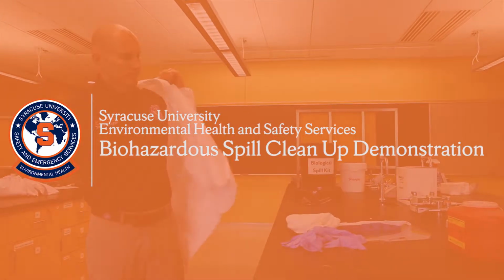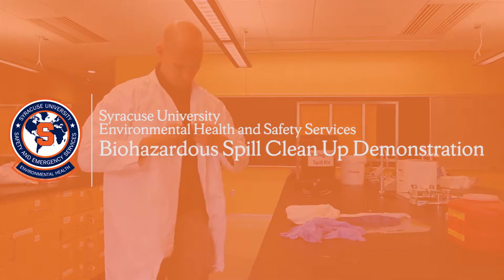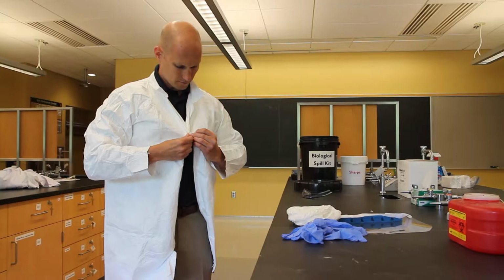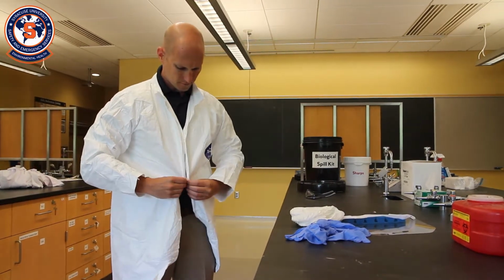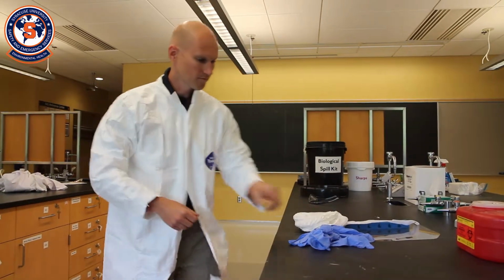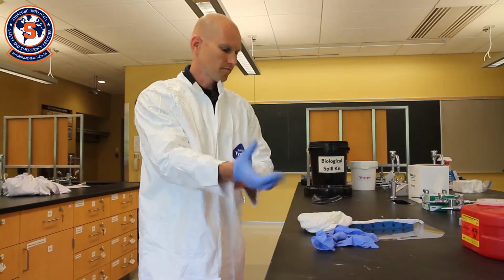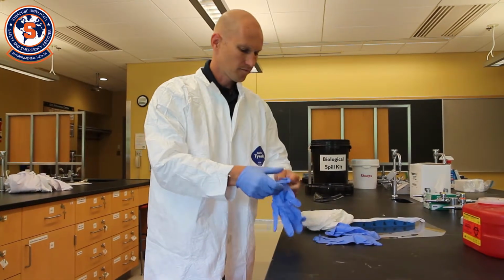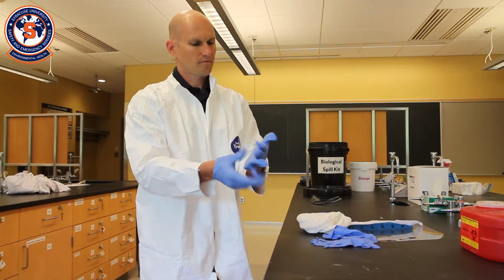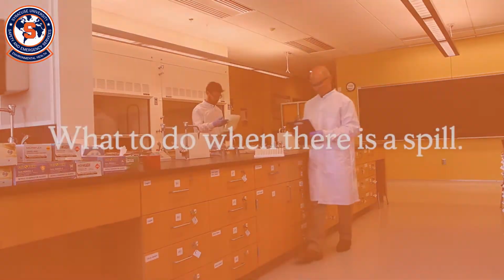Welcome to the Syracuse University Environmental Health and Safety Services Biohazardous Spill Cleanup Demonstration. This video will illustrate the procedures that should be followed to ensure a spill of biohazardous material is cleaned up properly. Each laboratory is responsible for developing procedures to deal with spills, including specific disinfectant appropriate for materials and organisms worked with in the laboratory.